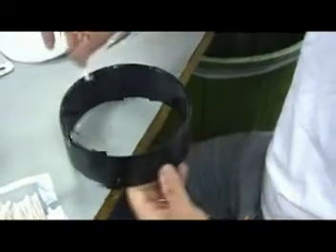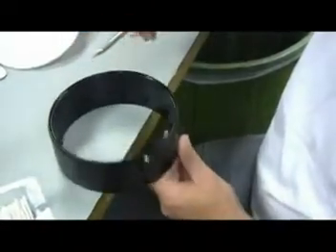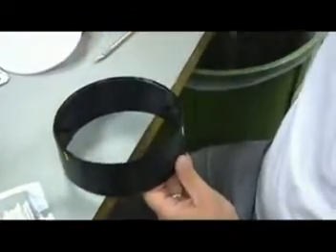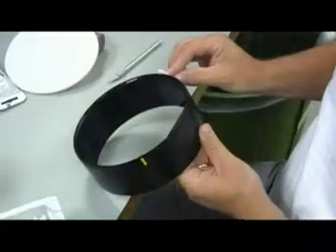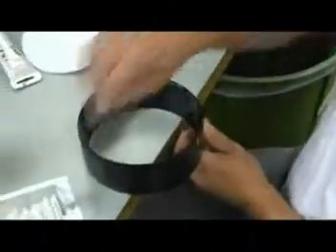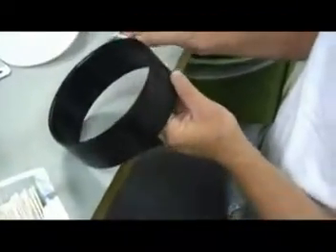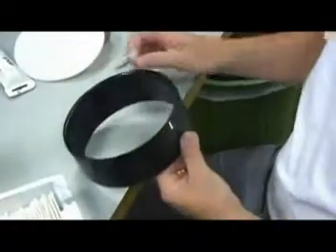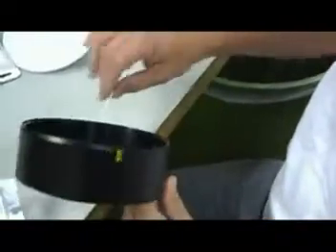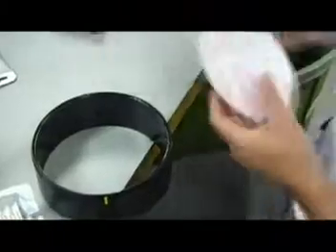What we want to do is hold the Q-tip at a 45 degree angle so it touches the bottom of the sample holder as well as the inside of the groove. Okay, and what we're going to do is take off the initial excess. So holding at a 45 degree angle, we'll go entirely around the inside of the sample holder. And now what we'll do is come around the outside of the sample holder and just get the bulk excess away. Okay, this is kind of where we're now doing the entire inside edge.